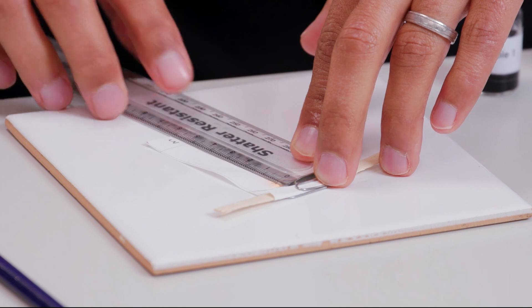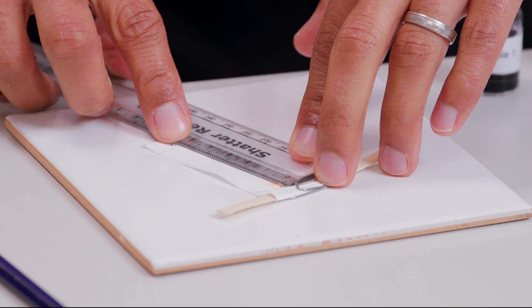The measurement here is 5.0 centimetres.